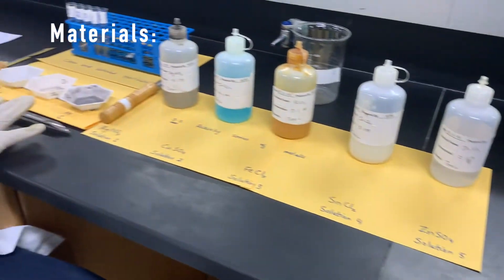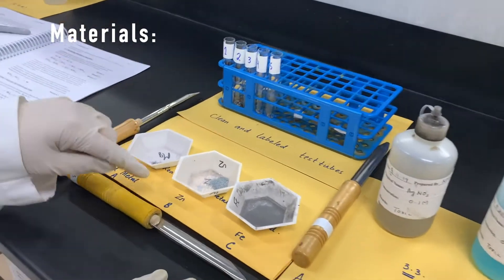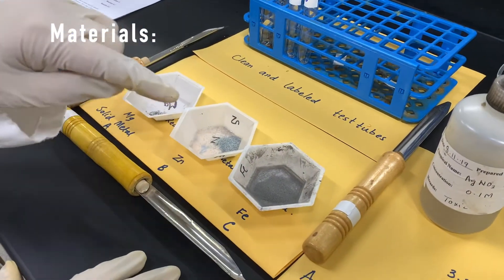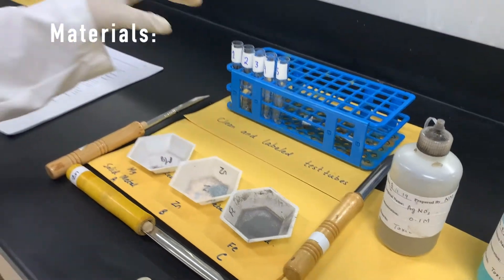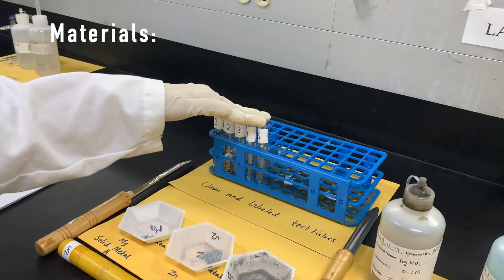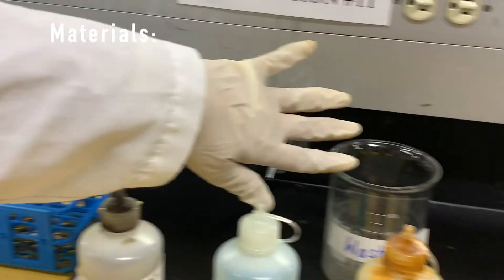We need three metals. Solid metal A is magnesium. Solid metal B is zinc. Solid metal C is iron. We need five clean and labeled test tubes in the test tube rack, and we need the waste beaker.